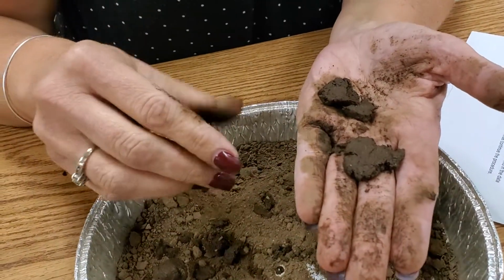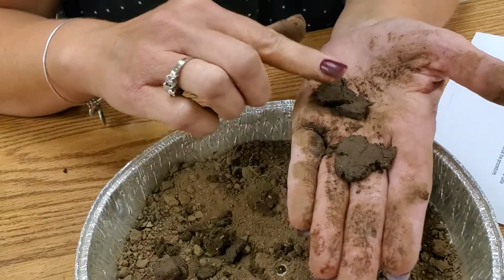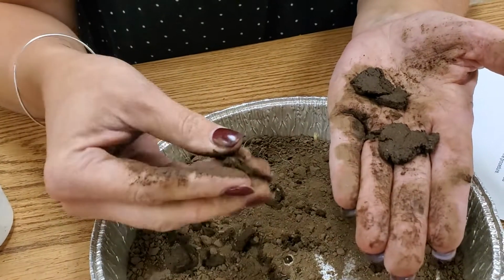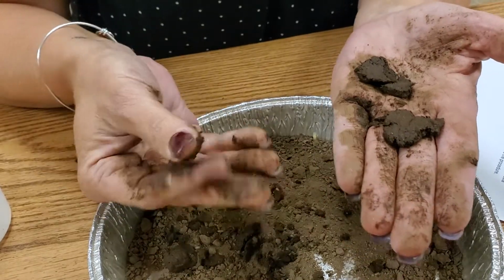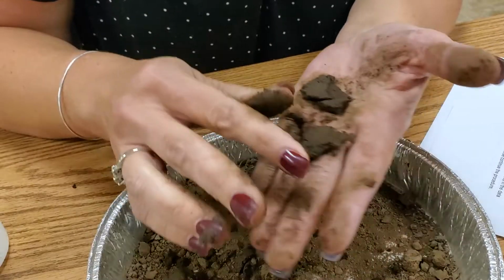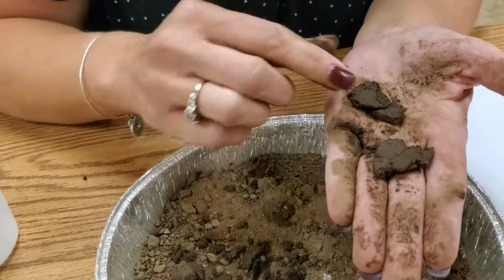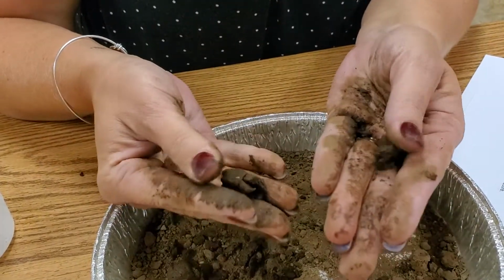But if you're able to form a ribbon that's less than an inch and is smooth, it's a silty loam. So this is close to that inch mark, and it definitely is silty. It feels like flour, which is a really good way to explain what it leaves on your hand. And I definitely have a loam of some kind because it has a little bit of clay, because it's leaving marks on my hand. And it has a little bit of gritty texture to it, but not much. So it tells us that we're going to call this a silty loam texture, and I definitely would classify this as more of your loam soil.